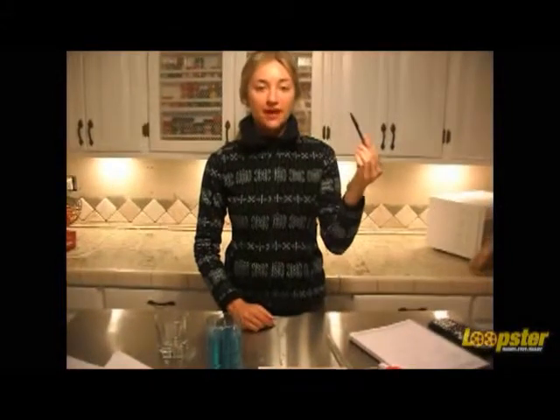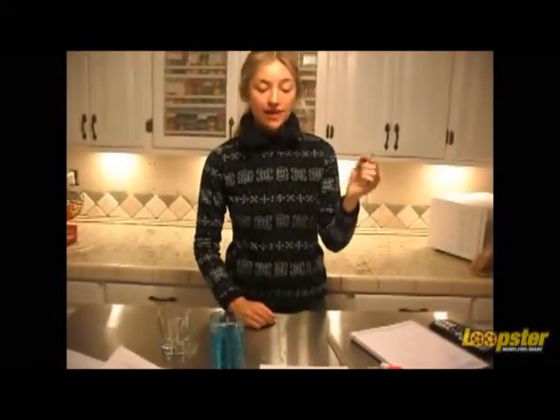Alright, first things first. Before we begin measuring the total volume of a substance, we need to learn about what a meniscus is. A meniscus is the curve in the water, usually when it is placed in a cylindrical device, caused by the surface tension or adhesion of the walls. They can usually be convex or concave. In this case with the pipette, the meniscus will be concave.